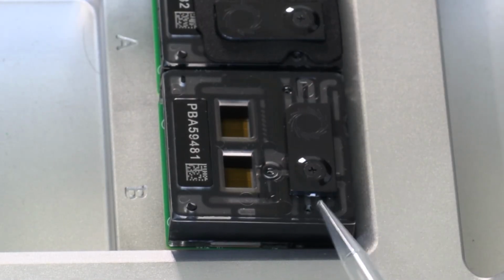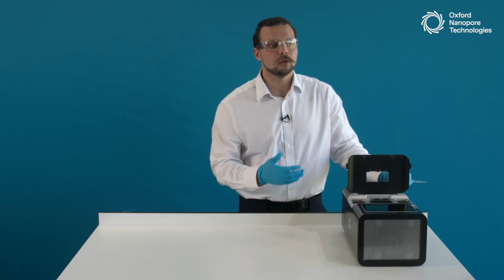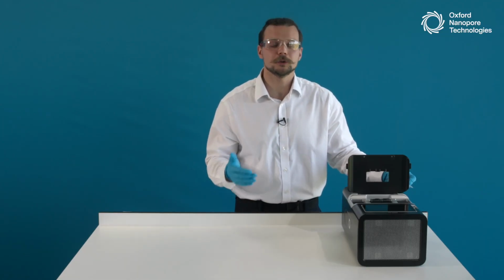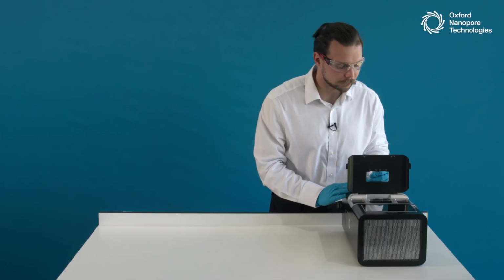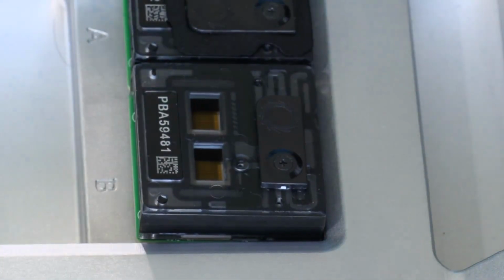The ports numbered 2 and 3 over here are the waste ports that normally you only need to use if you're performing a flow cell wash for repeated use or if you're reloading the library onto the flow cell. Today, since we're only loading once, we will not actually need to interact with them. Now, I think we can proceed with loading.